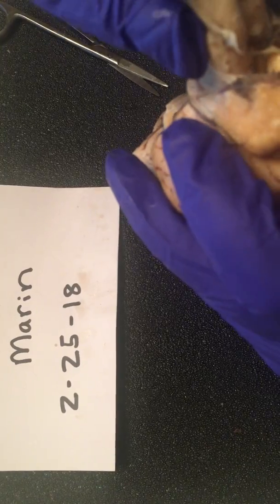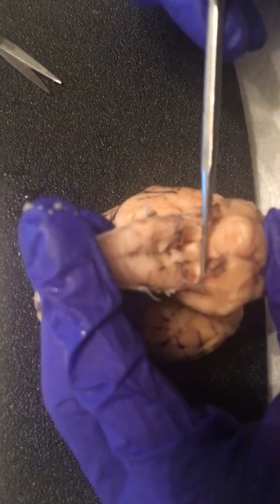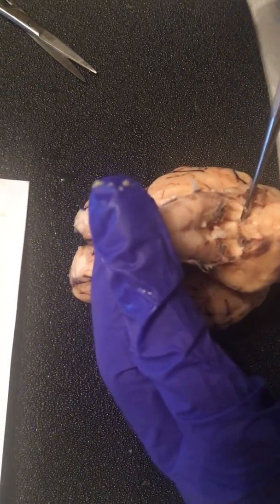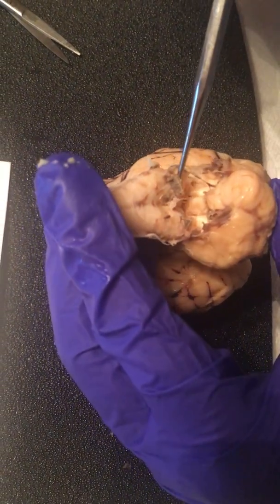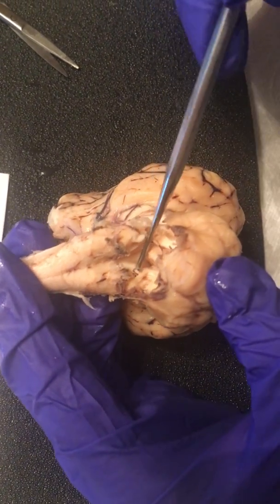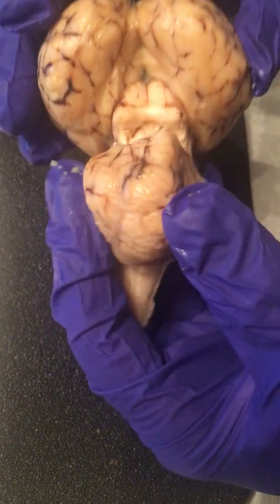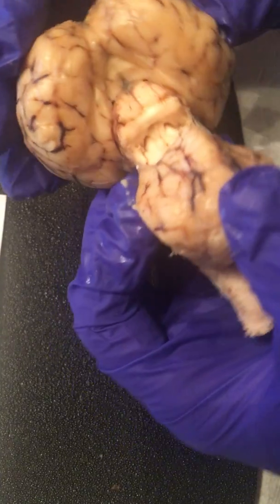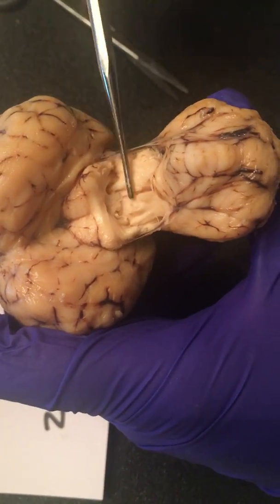All right. Also want to go and show you the nerves. They're in here. You can see some right in here. And some right here. There's one right there. And also, you can get in here, there's some nerve right there.